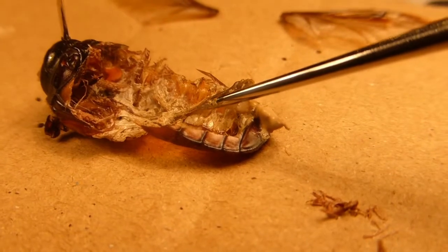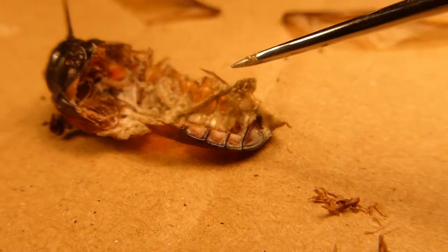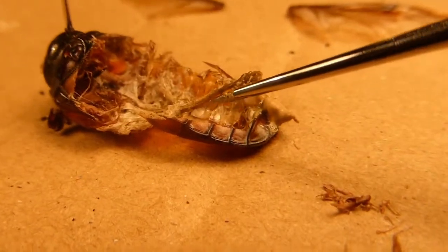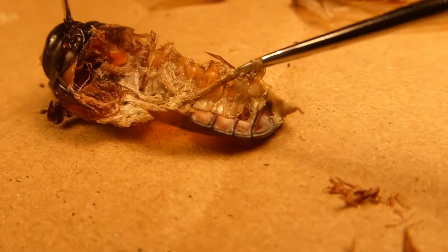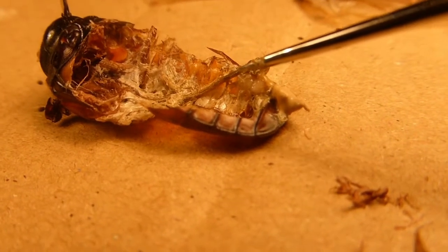Here is a much better view of the heart structure, which runs down the back of the abdomen — the dorsal side. These accessory hearts will pump haemolymph around the body to allow oxygen to diffuse into the insect's tissues.